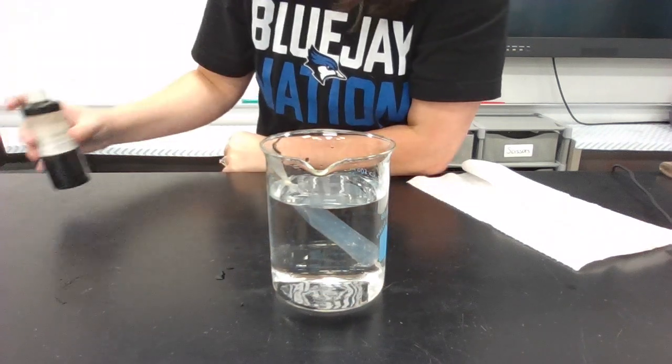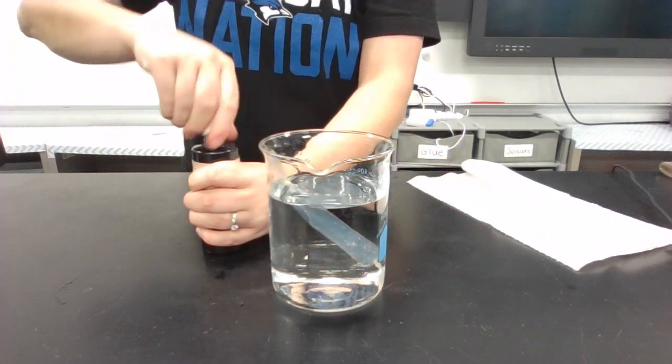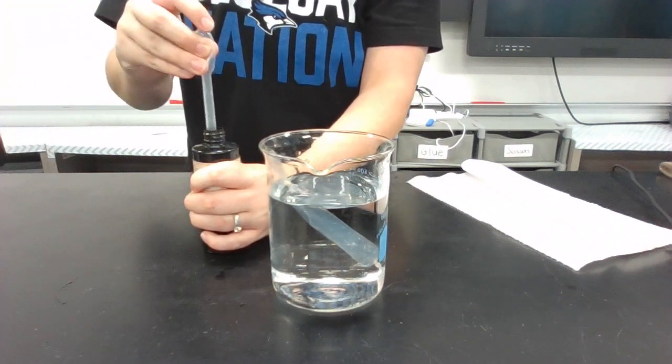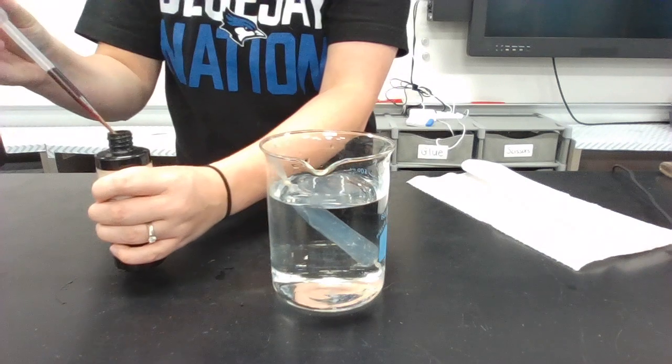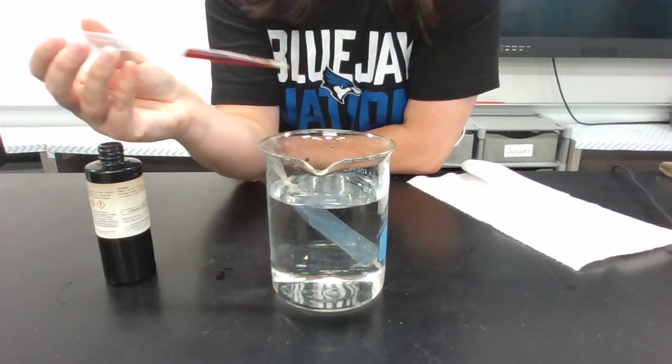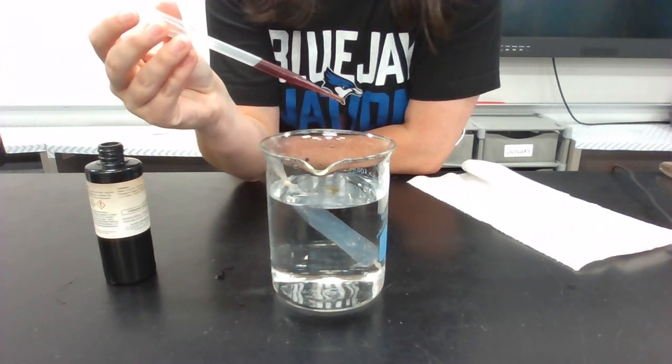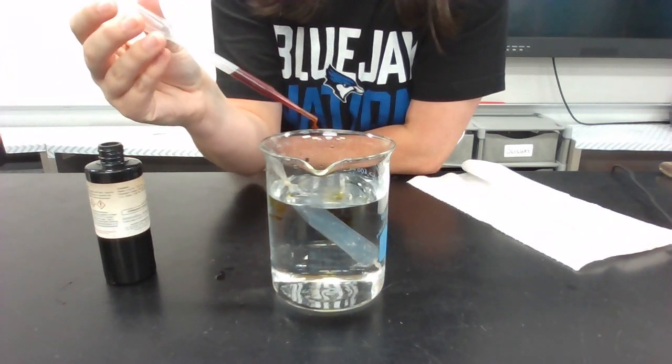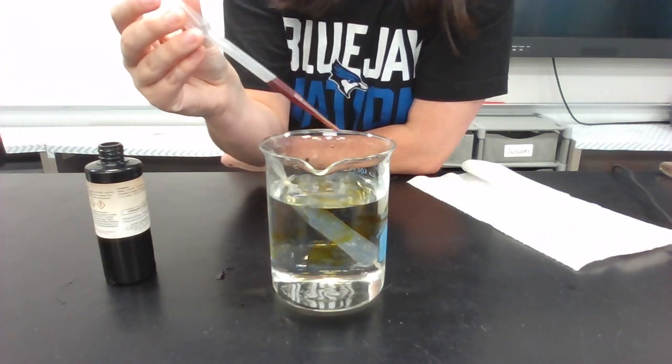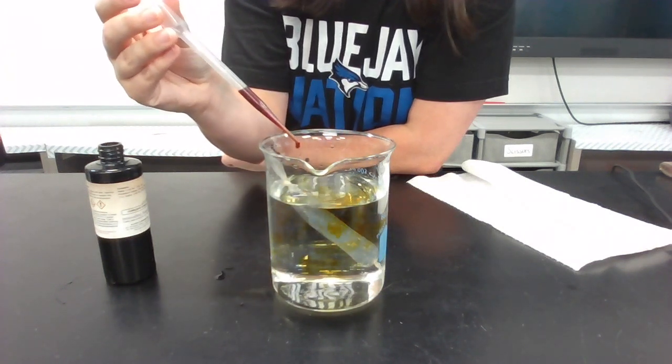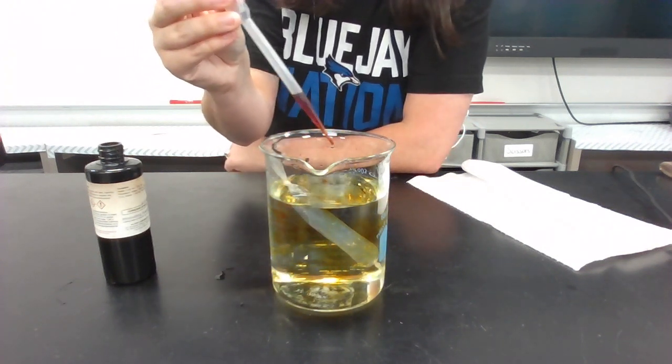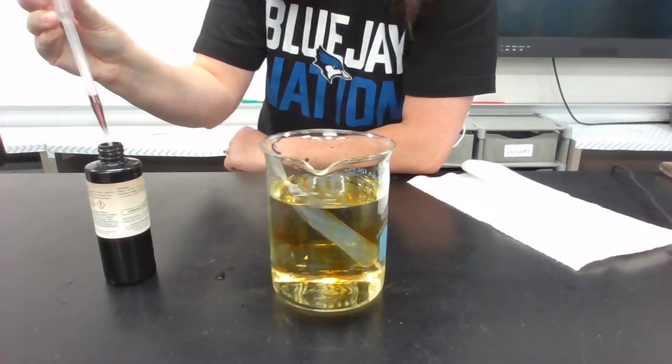So after that, I'm going to take my iodine solution and my pipette. I'm just going to put, I don't know, maybe 15 drops, 15 to 20 drops of iodine solution into this beaker of water.